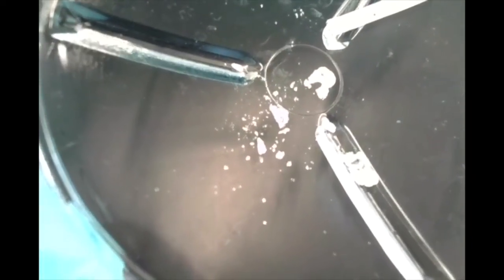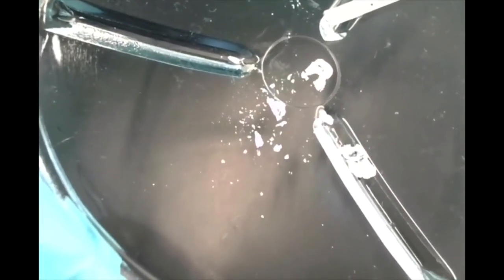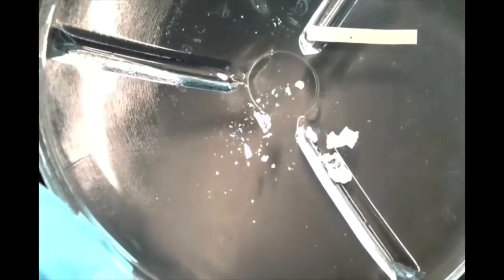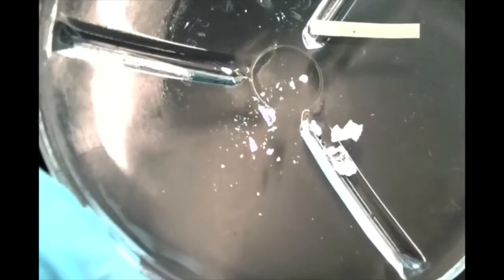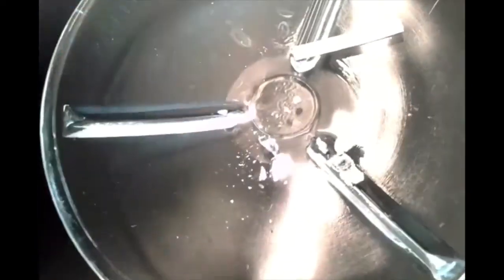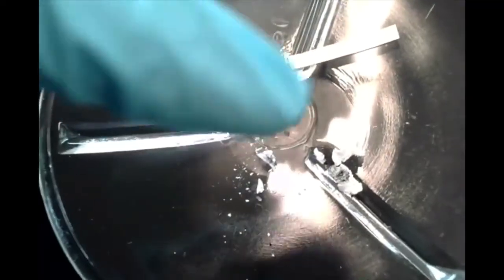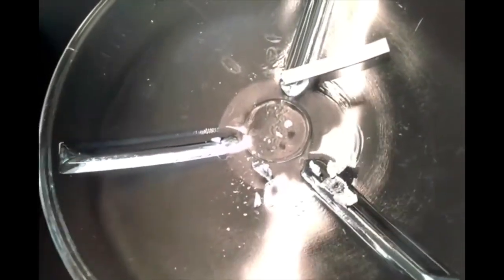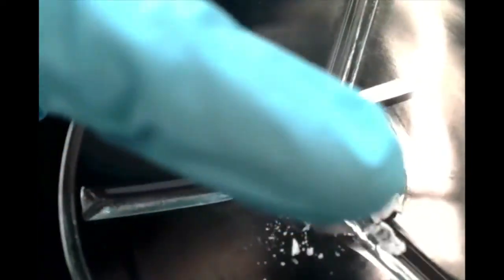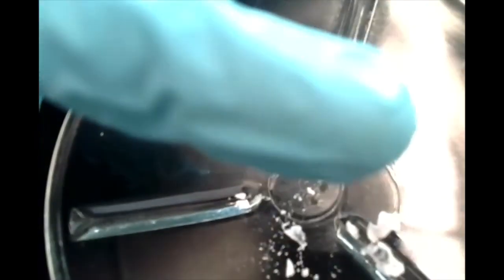Here's another shot of the magnesium oxide, hopefully coming into focus. So hopefully that gives you an idea of the white powder that's made. You also notice some white smoke being produced. That white smoke was just tiny particulates of this magnesium oxide powder just being picked up because of the heat. So that white smoke you saw is the same as this powder you're seeing over here right now as well.